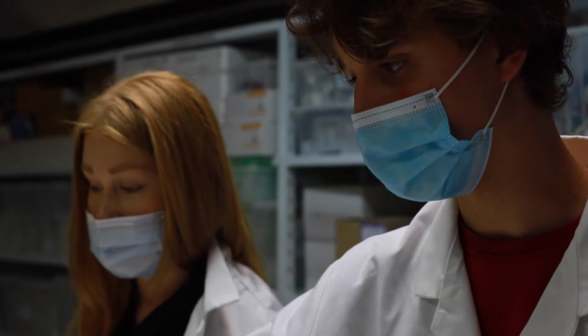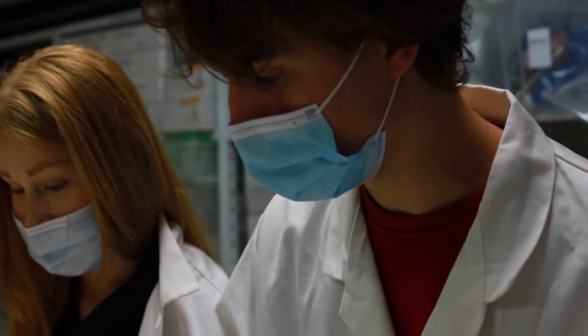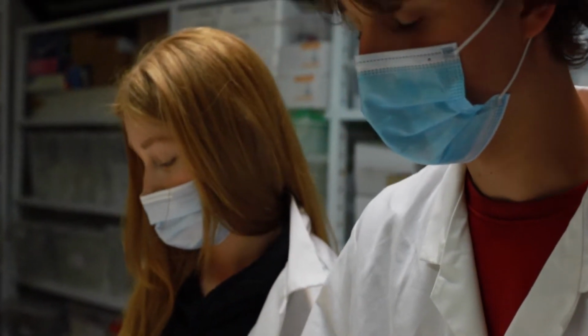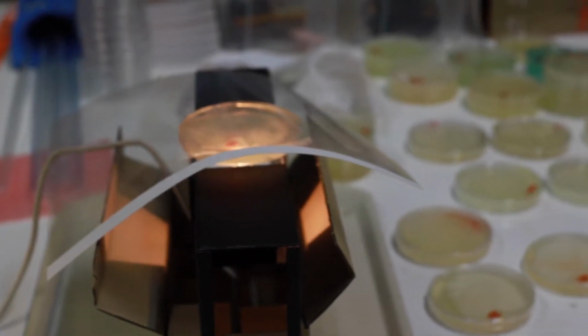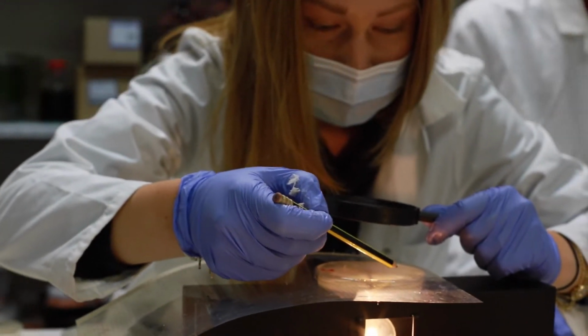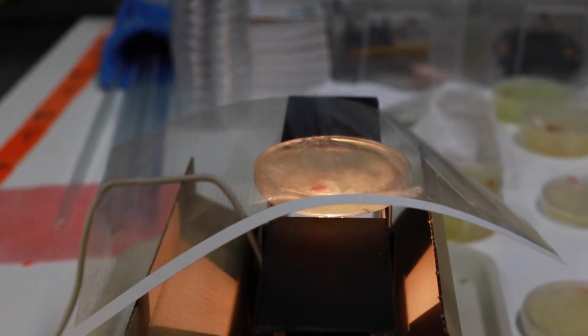So this is a light box, and these are the petri dishes in which we grew the bacteria, and then yesterday we added the antibacterial substances and we left them overnight in the incubator. So now we're using this sheet of graph paper to count how many squares are covered by bacteria in order to determine which substance killed most bacteria.